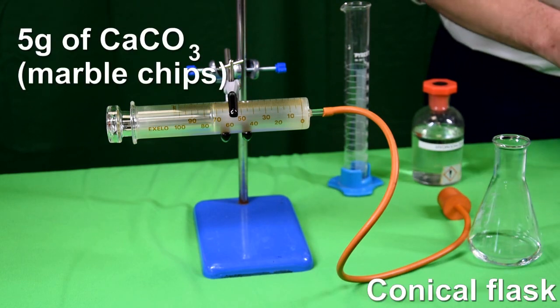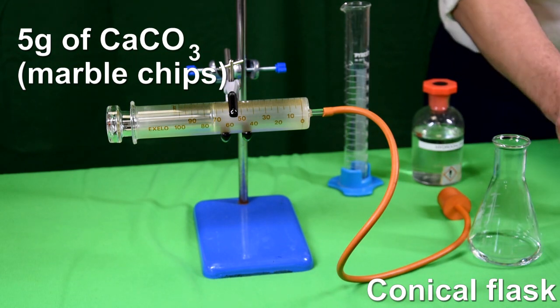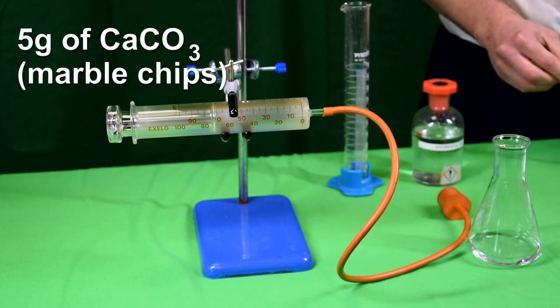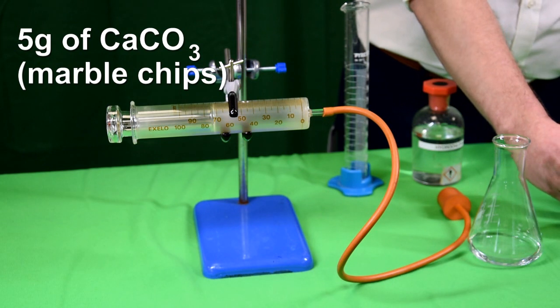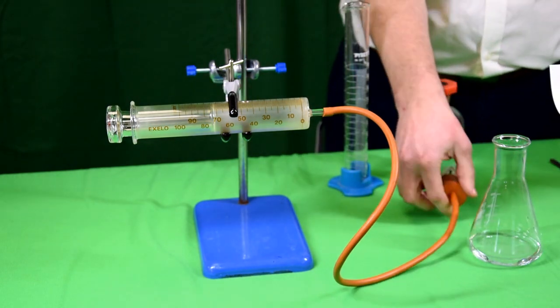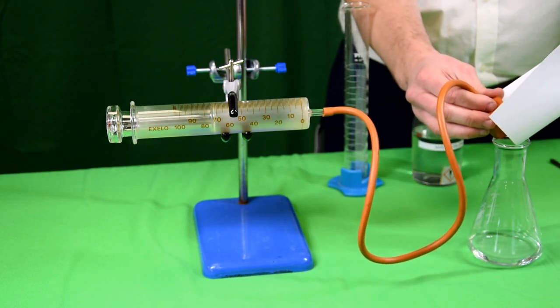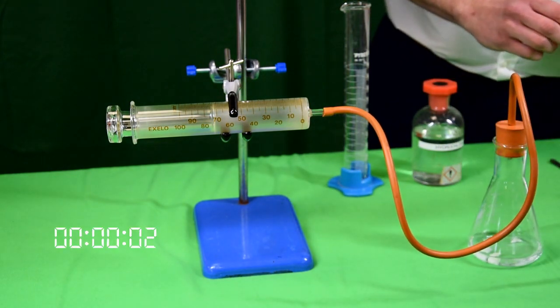5 grams of large marble chips are measured out using a top pan balance. The marble chips are added to the acid in the conical flask and the bung placed in as quickly as possible. A digital timer is then started.